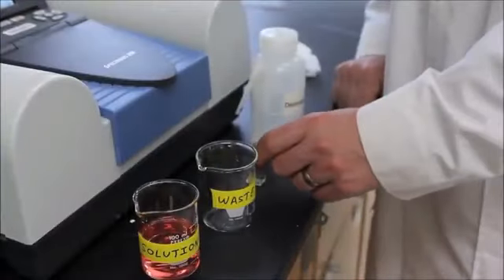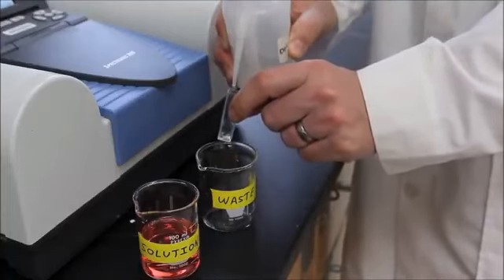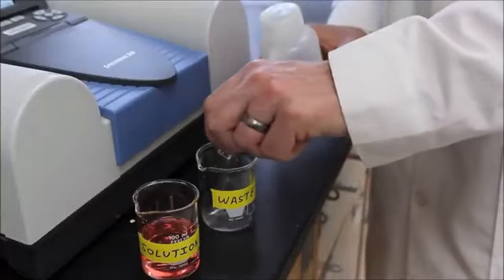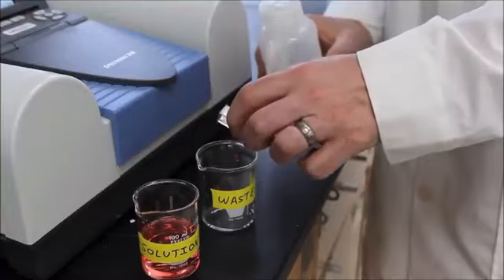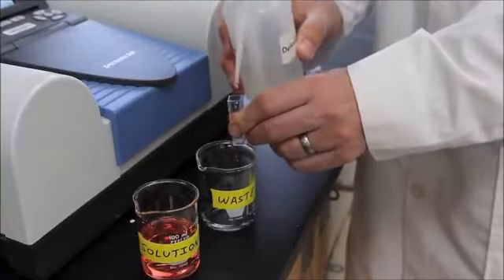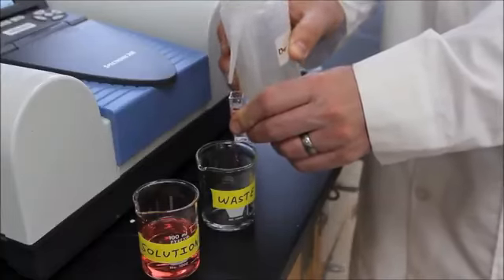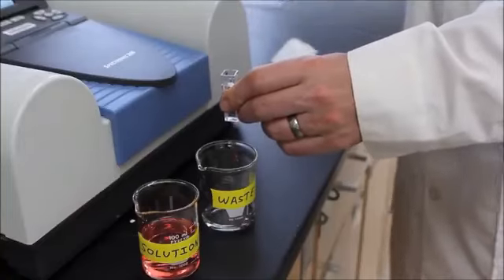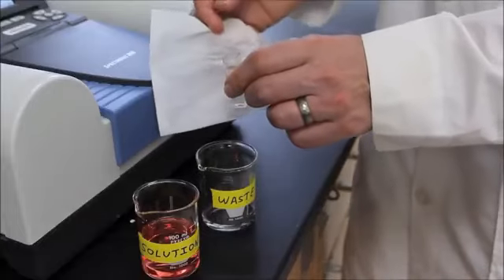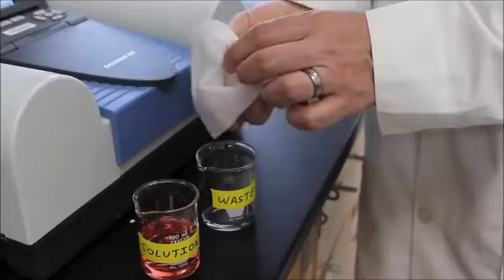We are now ready to clean the cuvette. Hold the cuvette by its frosted sides and fill the cuvette with a small amount of deionized water. Empty its contents into a waste container and repeat this cleaning step 2 additional times with more deionized water. Then fill the cuvette at least 2/3 full with deionized water, which will serve as our blank solution for this experiment. Finally, wipe the non-frosted sides of the cuvette with a chem wipe to remove any smudges that may be present.